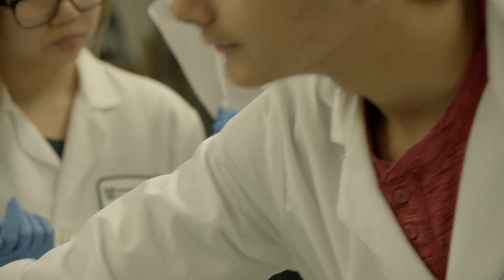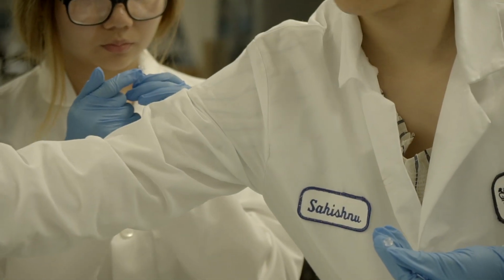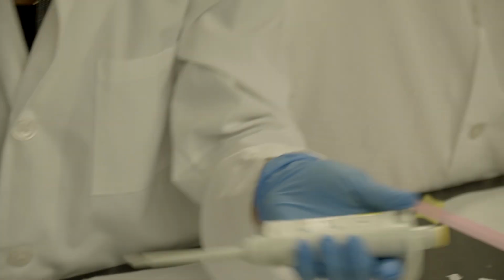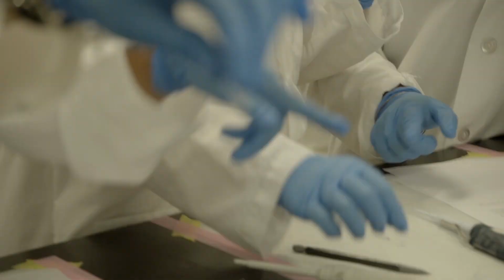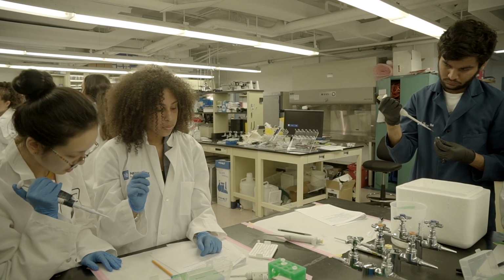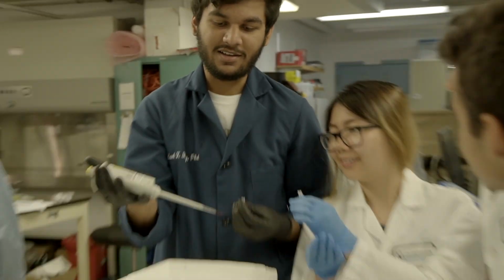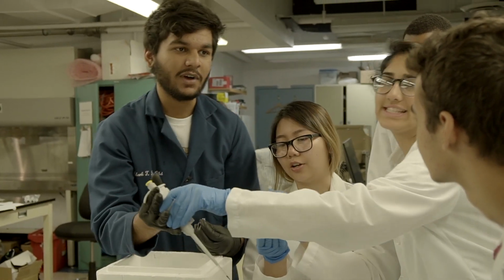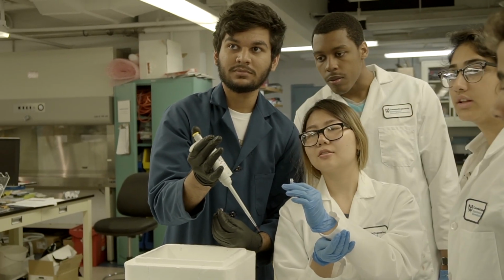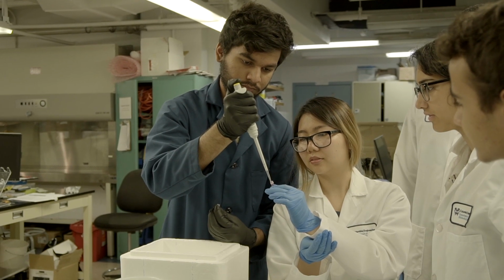What was your label? Last time, the letter B. Did you label your restriction digest one as well? Not yet. Okay. So, hang on, let's wait. For me, I always go in smaller. Rachel's going to show you the vortex, and then come back to it. Five is weird. If it's 6, that's fine, because you're potentially going to create bubbles if you try to put it back.